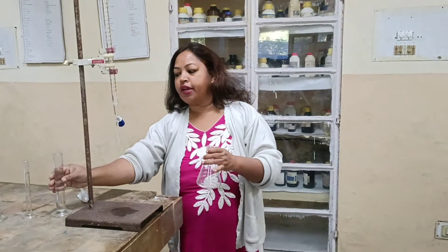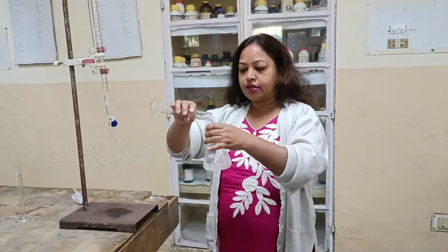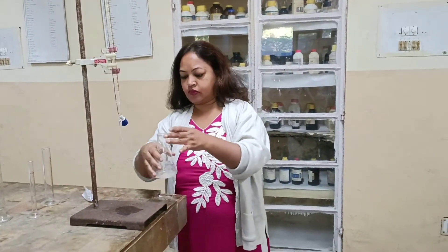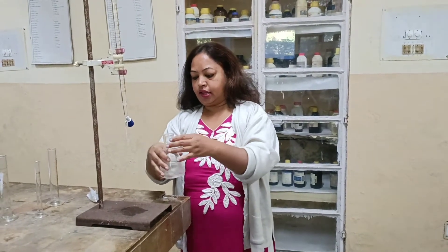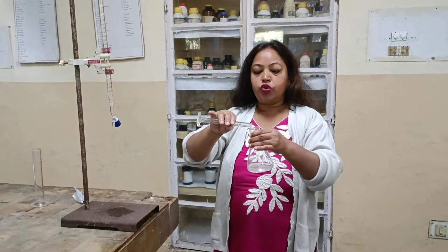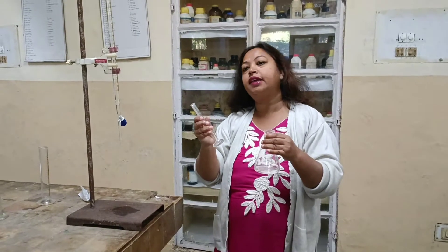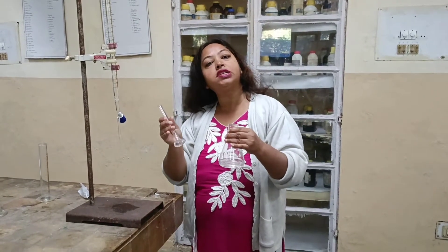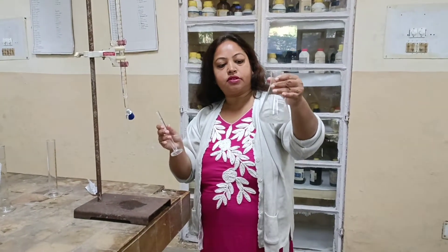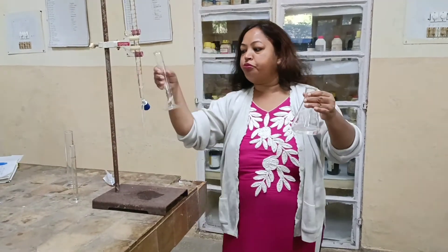Now we will add 50 ml of water to dissolve it, and 5 ml of magnesium sulfate to give a very sharp end point. This is the main reason for adding the magnesium sulfate — it will give a very sharp end point. We are also adding 10 ml of buffer in this complexometric titration.